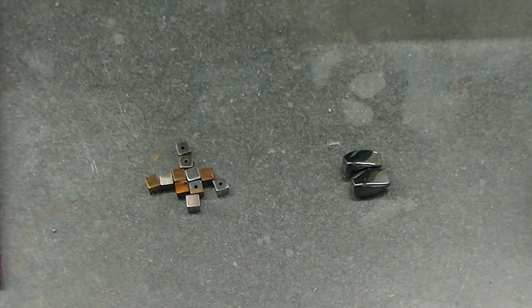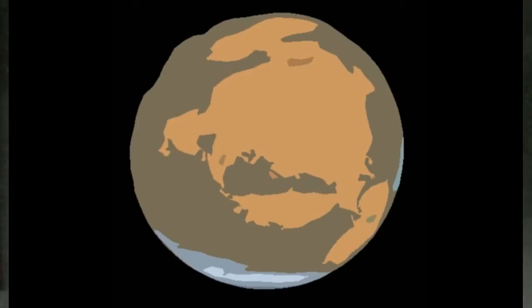First I'm going to pulverize each of these beads to see what the powder looks like. I'm going to do this because powdered hematite is red in color. In fact, the presence of hematite on the surface of Mars is what gives Mars its red color.